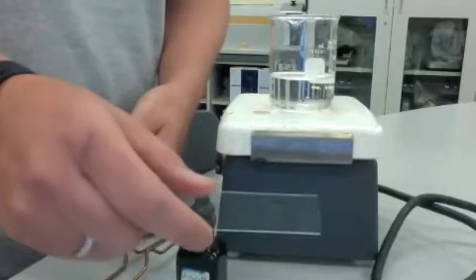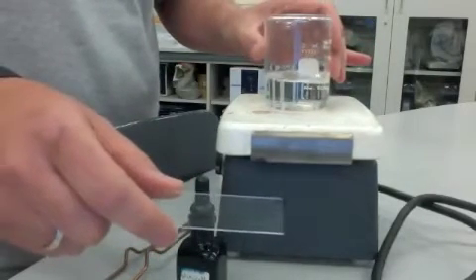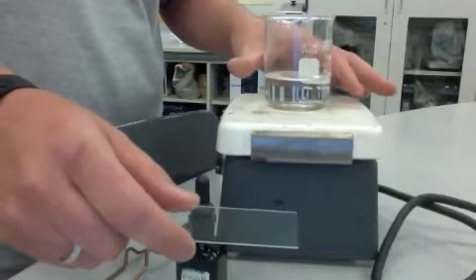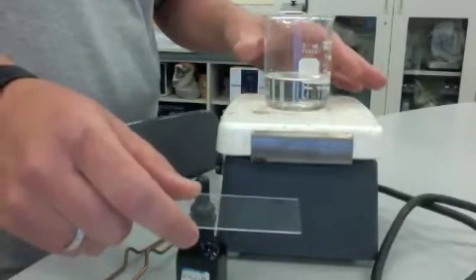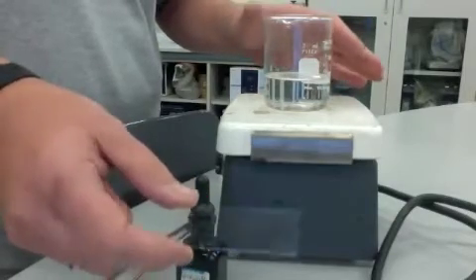Then you take your bacillus sample and put it on a beaker that has some boiling water on it. The combination of the heat and the correct stain, the malachite green, will allow it to get into the spore.